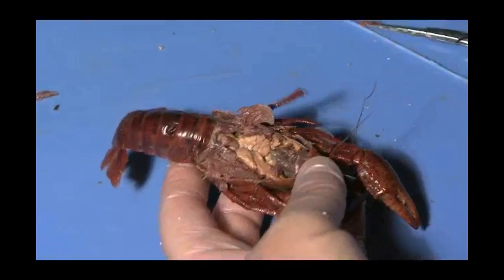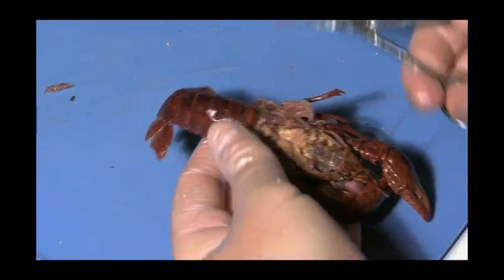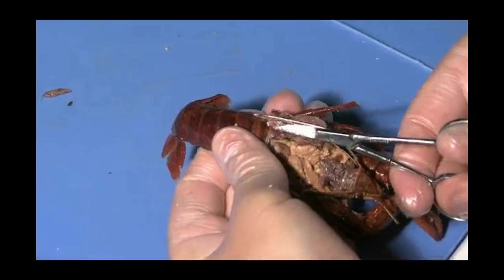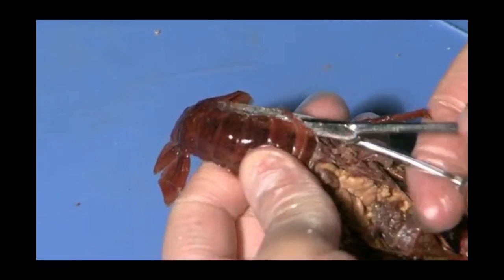Once you've identified these structures, use your scissors again to cut a few segments off of the abdomen along the sides.